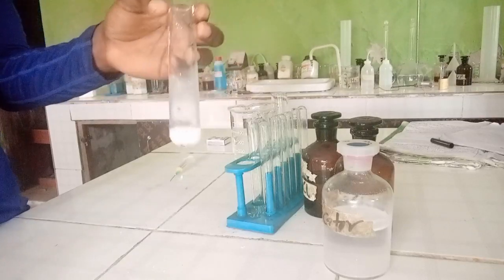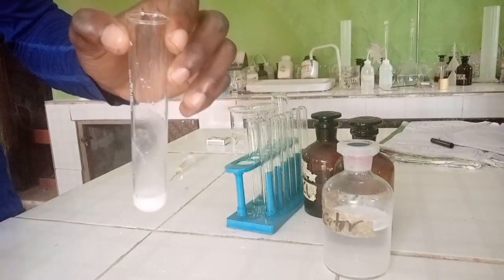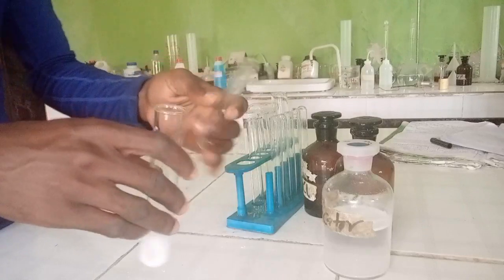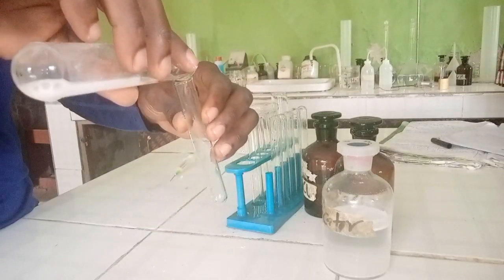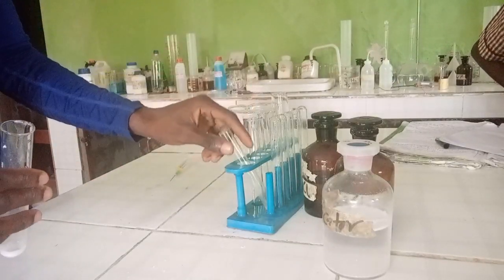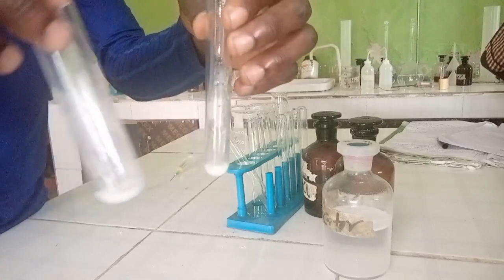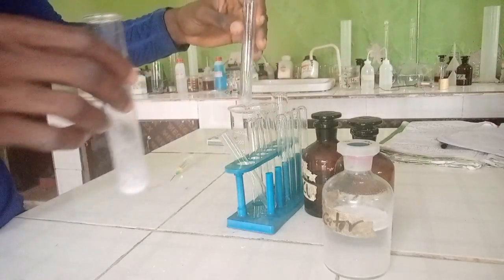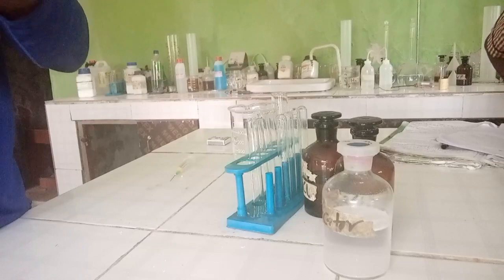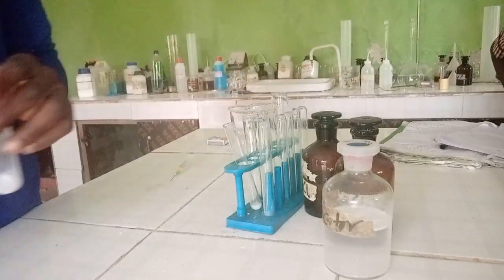This shows that the salt is soluble in water. The observation is that salt C dissolved to form a white solution, and the inference is that C is soluble in water. Now we are meant to divide the solution into two portions — so this is the first portion here and this is the second portion. Let's carry out the test on the first portion as stated in the question.